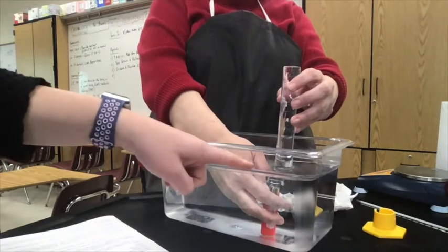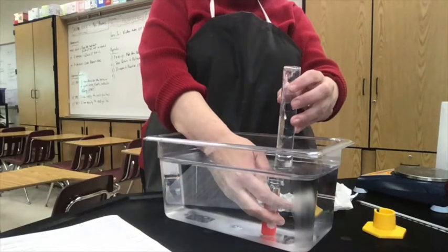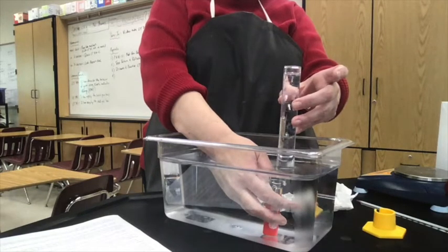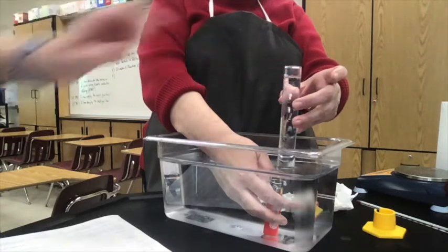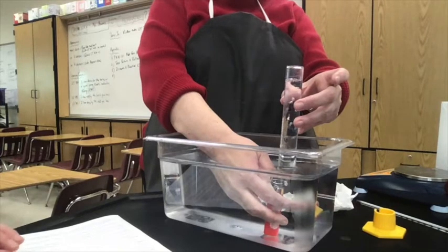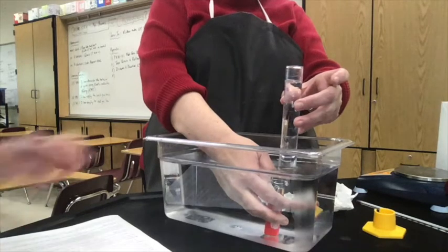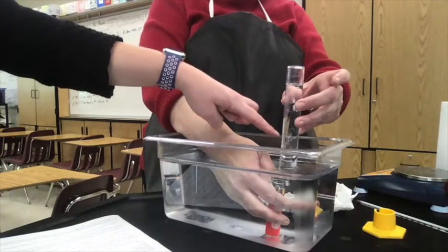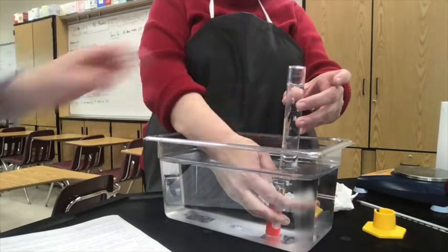And she's making sure that all the bubbles are going into the graduated cylinder, not on the outside at all, because if we lose some of the bubbles, that means some of our mass of butane is not going to be accounted for in that volume. You can see it going down there. We're collecting about 45 milliliters, and this is a 50 milliliter graduated cylinder. So right now we're at 5. We're going all the way down here to 45 milliliters.